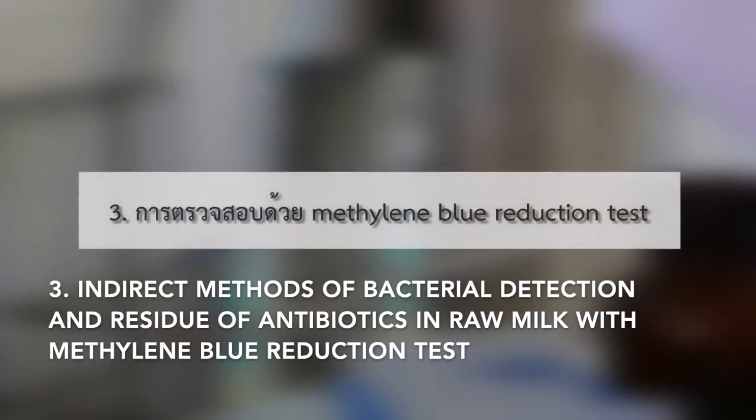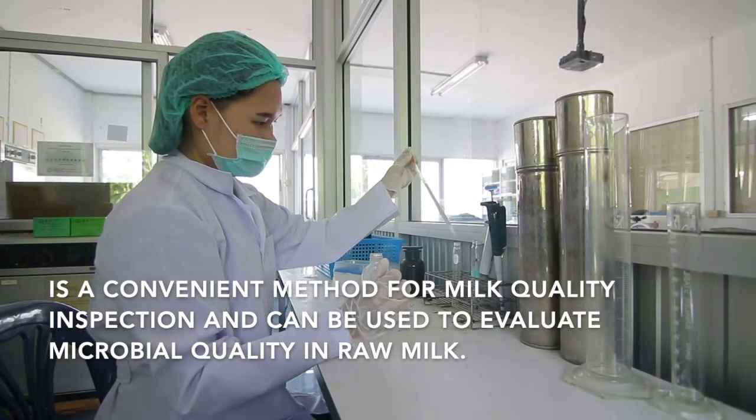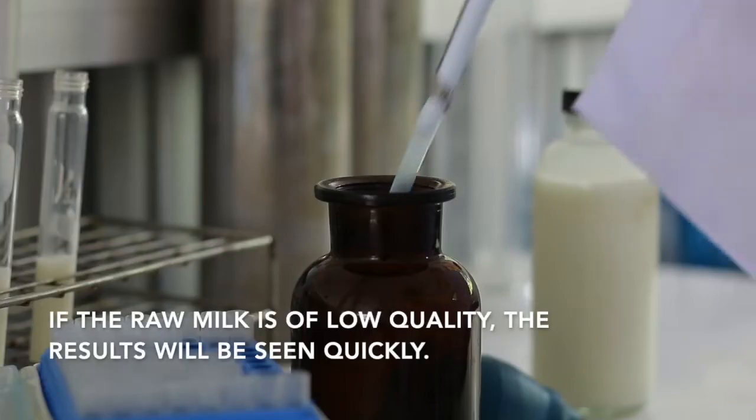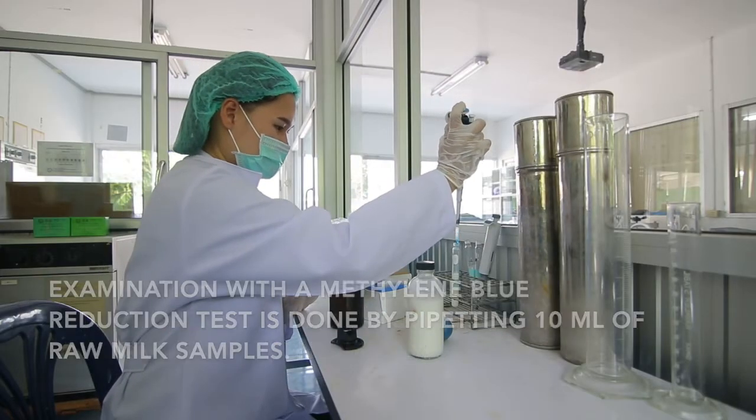Third, indirect method of bacteria detection and residue of antibiotic in raw milk with the methylene blue reduction test. It is a convenient method for milk quality inspection and can be used to evaluate microbial quality in raw milk. If the raw milk is low quality, the result will be seen quickly.